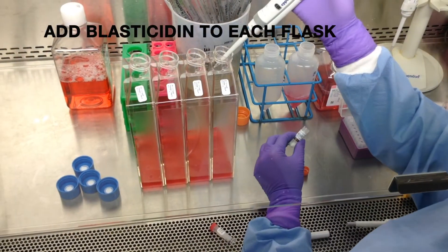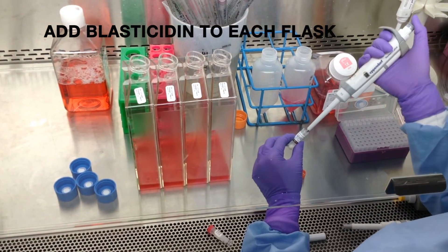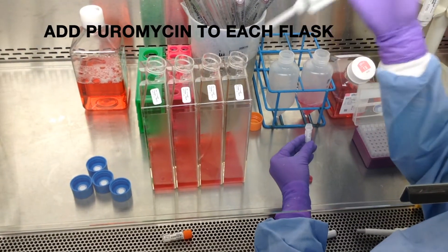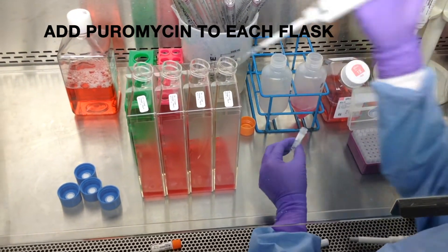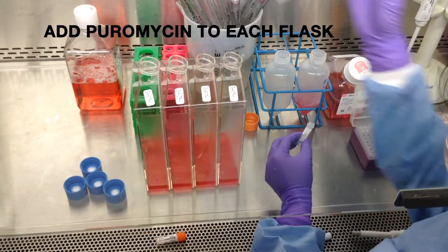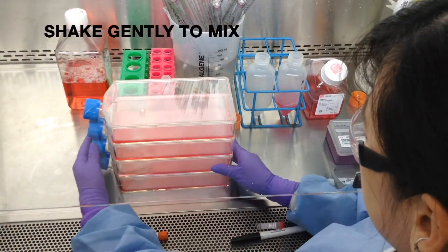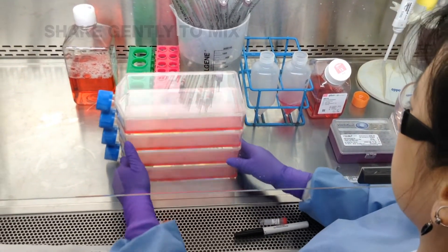Add blasticidin to each flask. Add puromycin to each flask. Mix the flasks gently and incubate.